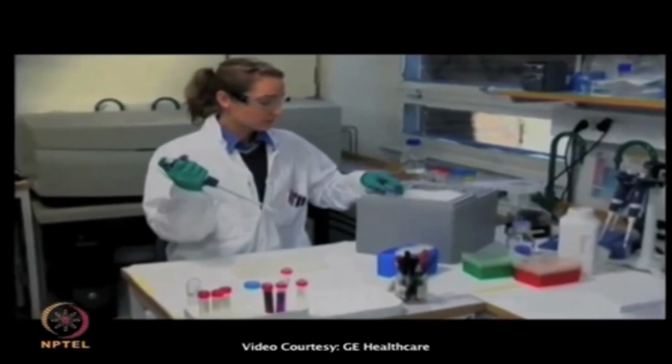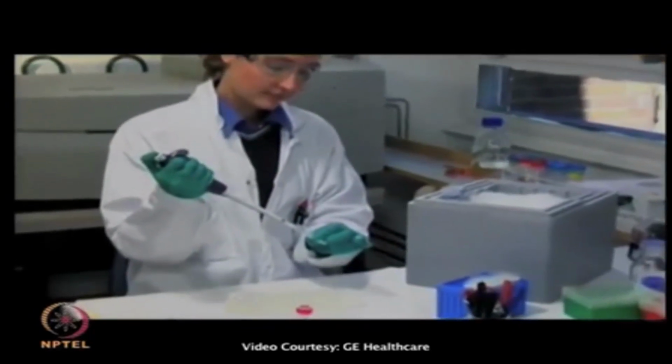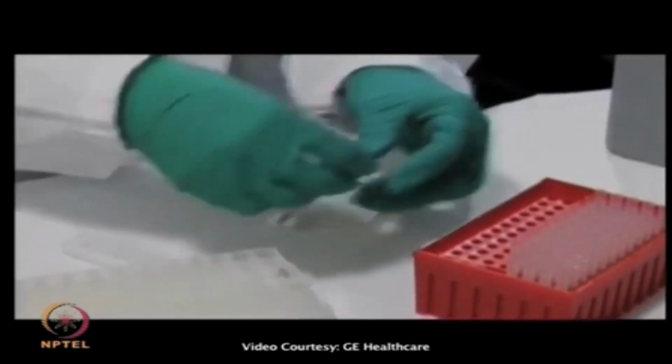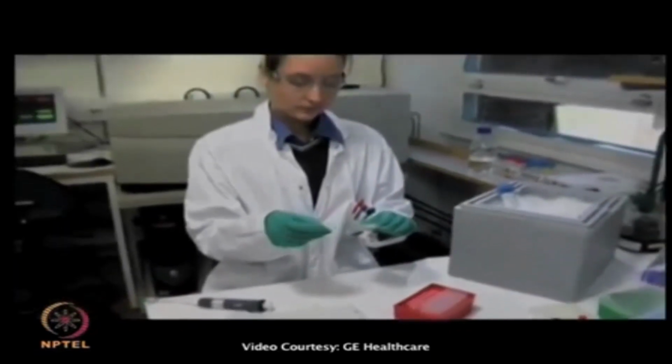After the wash, the cell pellet is resuspended in 200 microliters ice-cold labeling buffer containing HBSS pH 8.5 and 1 molar urea for optimal labeling conditions of cell surface proteins. Always check pH before labeling. We used 600 picomoles CyDye for 10 million CHO cells.